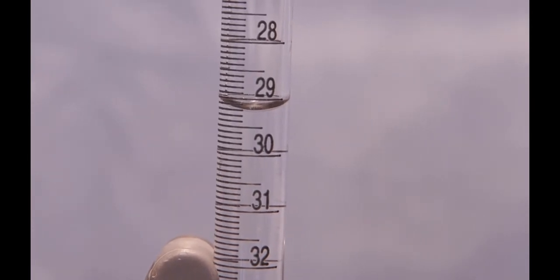Okay, for our end point, we've got 29.22 milliliters.